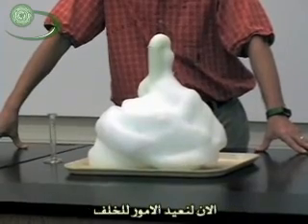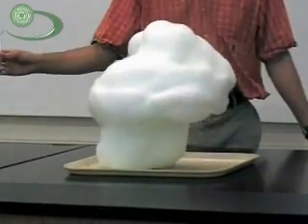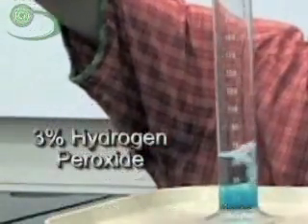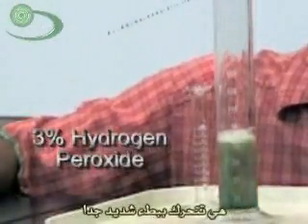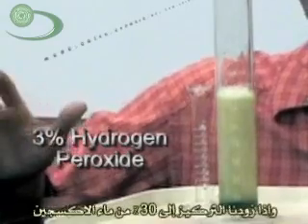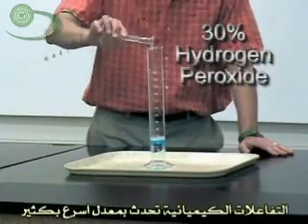Now let's compare one more time the 3% to the 30%. Going back to the 3% hydrogen peroxide, you can see it's moving very slowly because the collisions happen slower — they don't collide as often to cause the chemistry to happen. And then if we kick it up a notch to 30% hydrogen peroxide, the chemistry happens much faster.